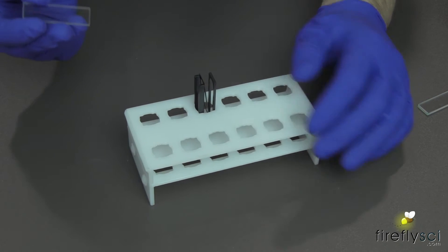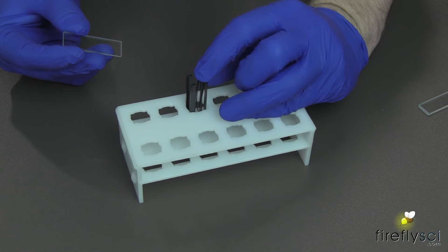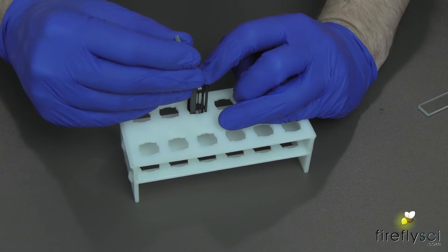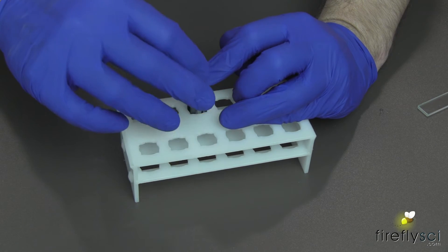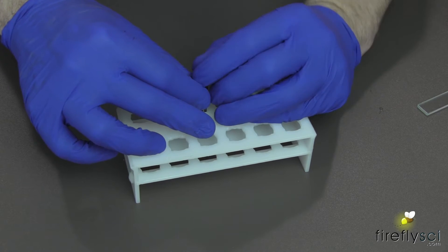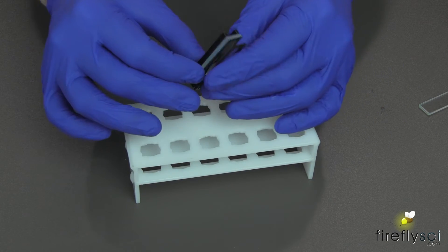To mount the Type 20 cell in the A20 cell mount, you simply pull back the spring — pull it all the way back — and just slide the cuvette right into place. Put the spring back gently, take your finger out, and boom, it's ready to go.